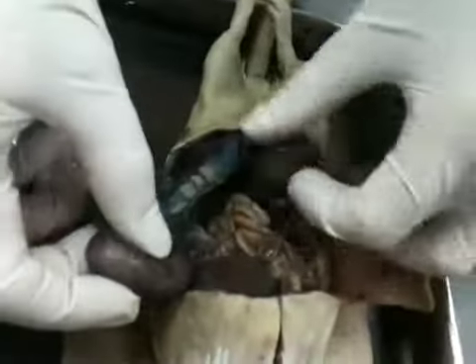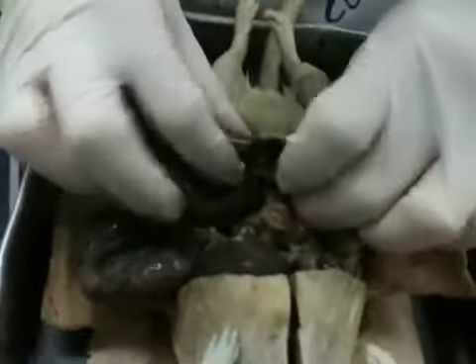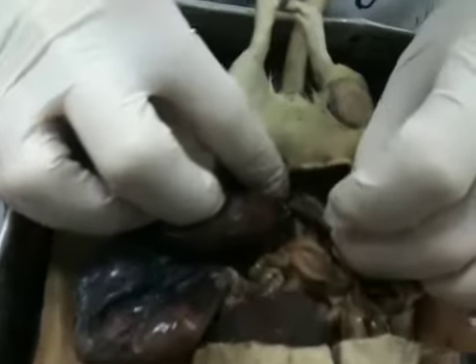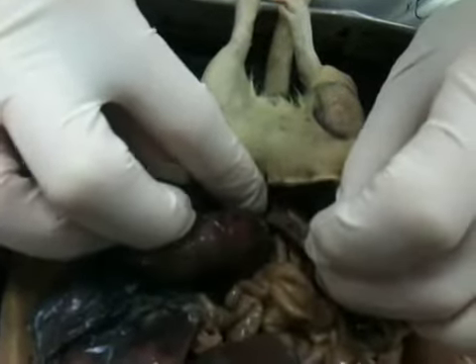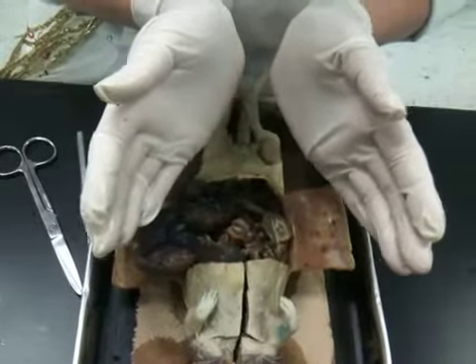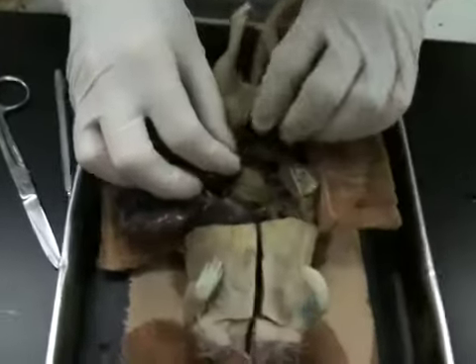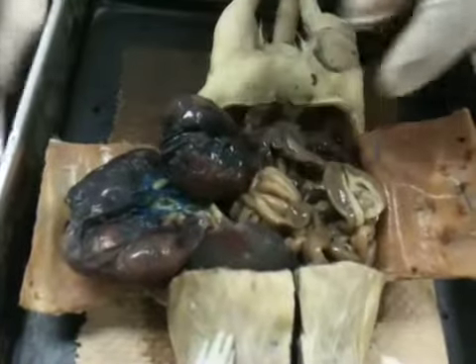Since we have uterine horn, we have to come down here to where it connects. This part right here where it connects is called the cervix. So again, uterine horns going this way. You can see a rat's uterine horns going up. That way they can have a litter, so do cats, some other animals. And then right here where those two uterine horns meet, that's the cervix.